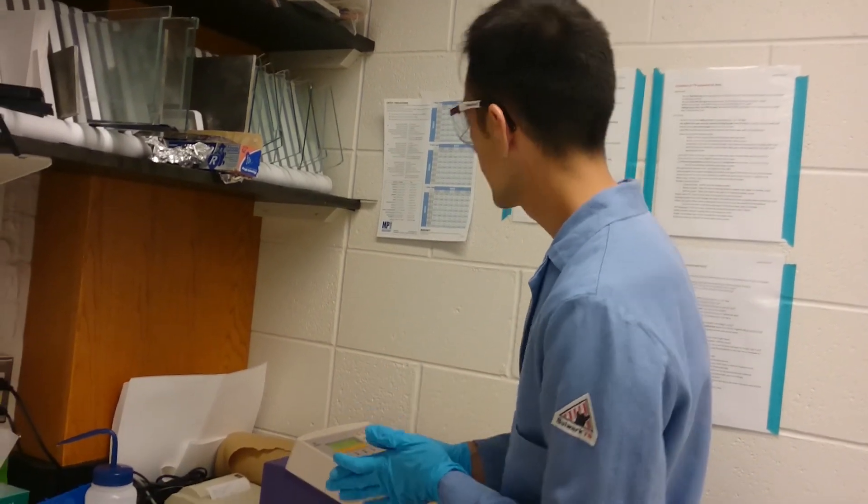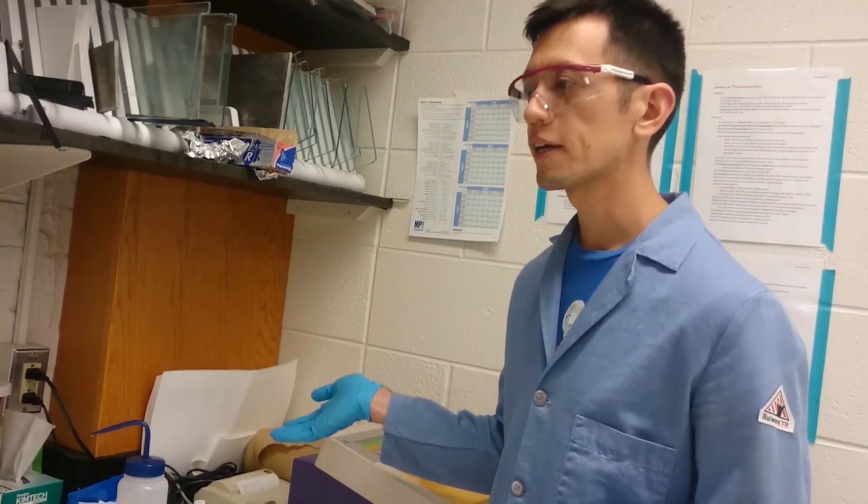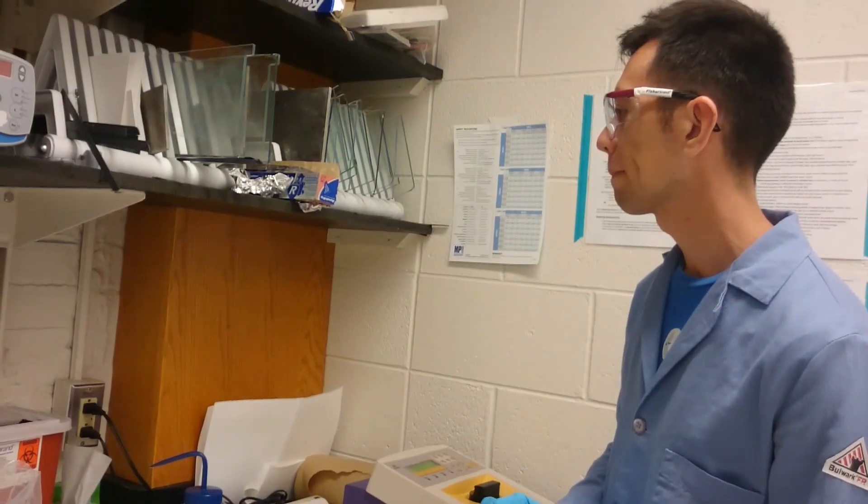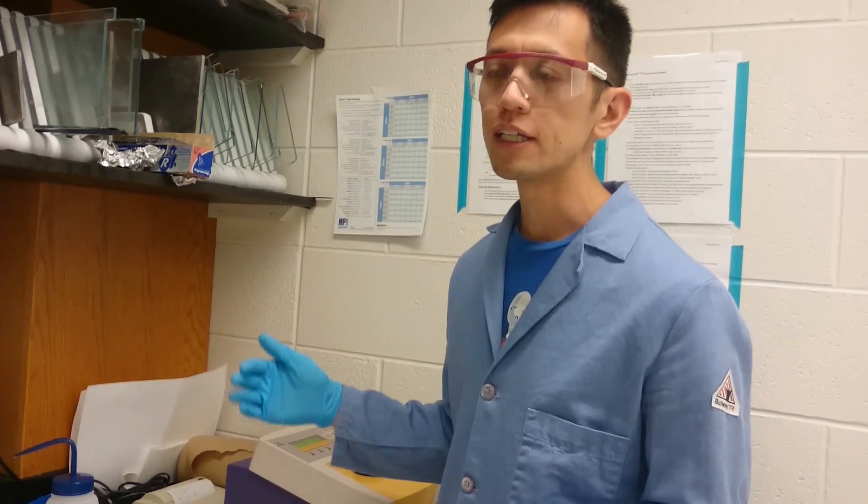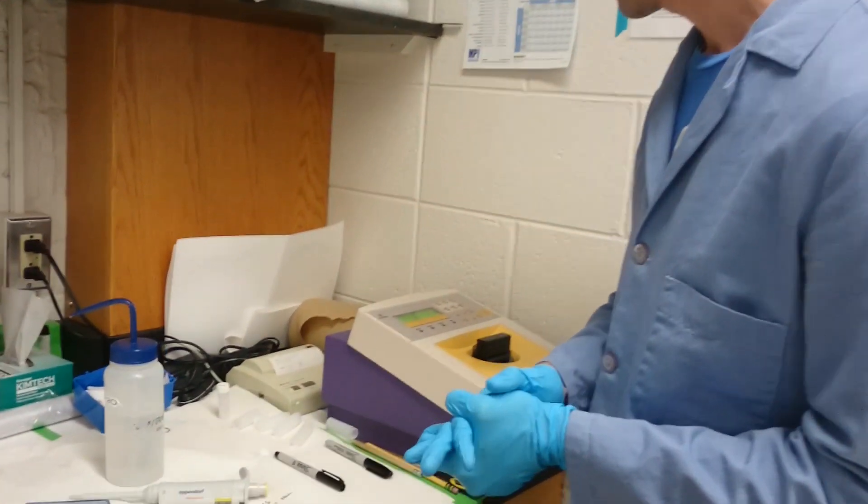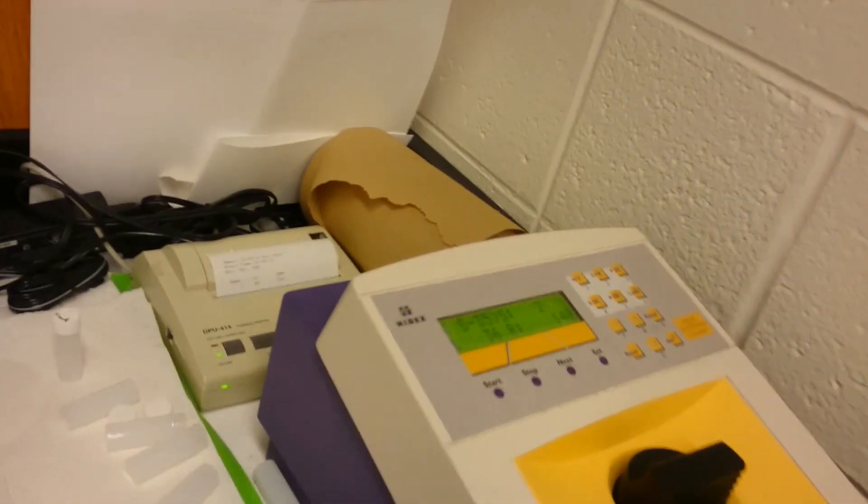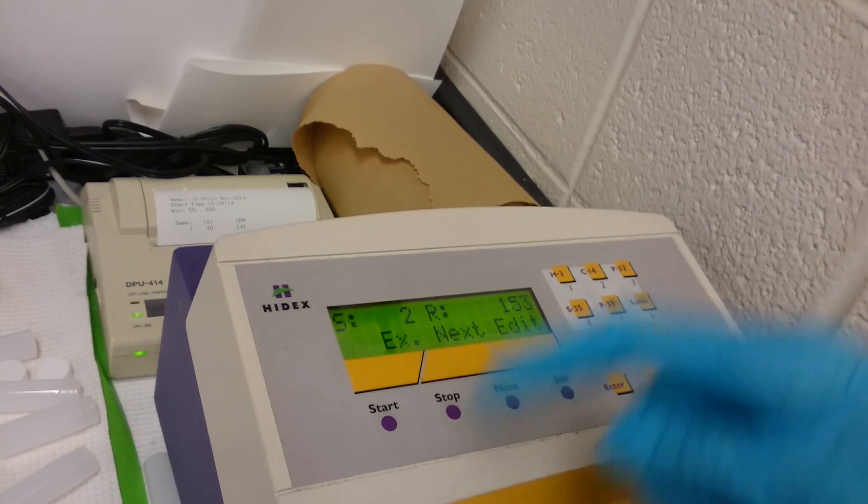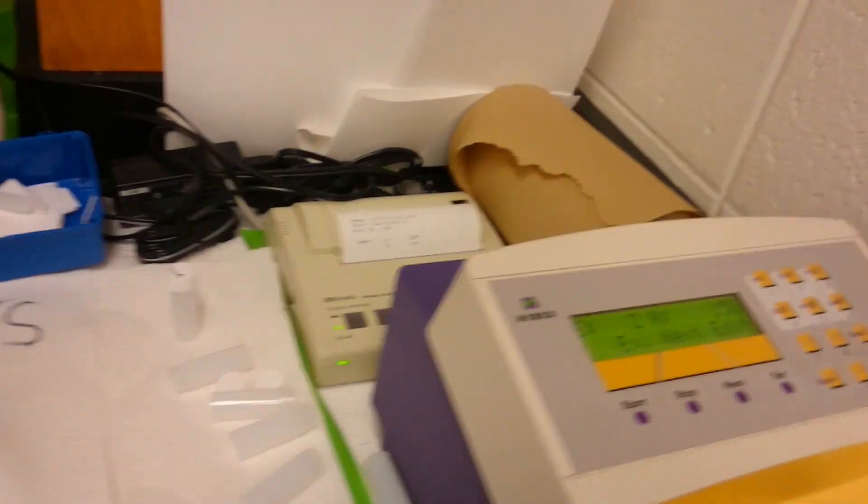Background in the lab is around 145. On this particular day, it's closer to 144. I found that this tends to be more sensitive, so if you get counts that are above 220, it's usually worth reswiping or cleaning and reswiping. This looks pretty good. The final count is 153, that's pretty close to background which is 144. So these are considered to be clean.